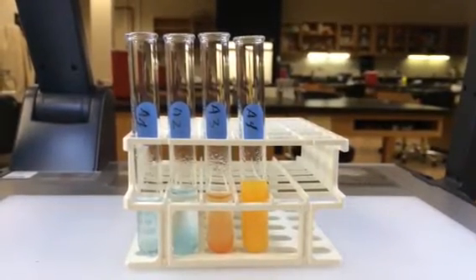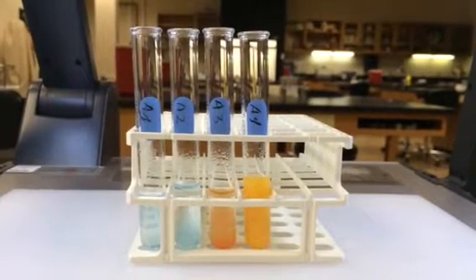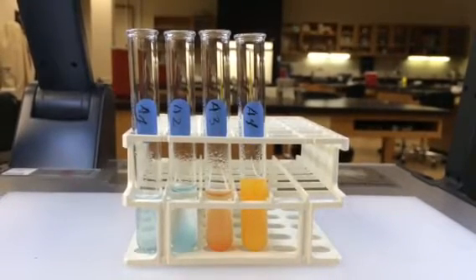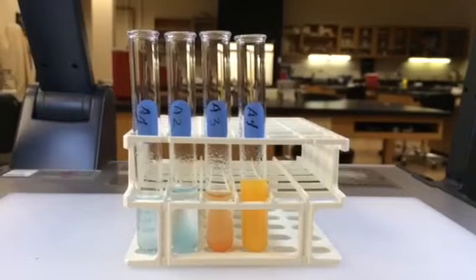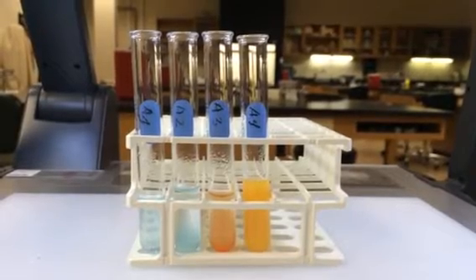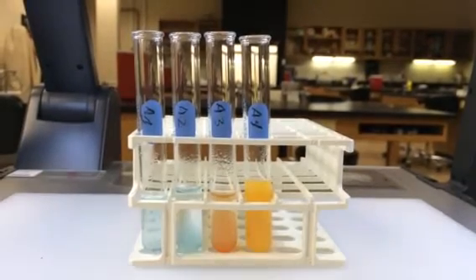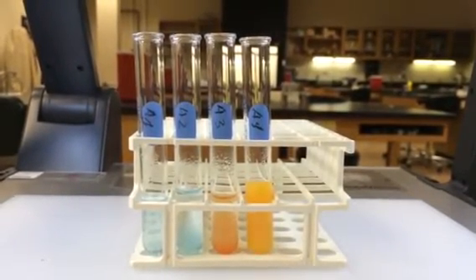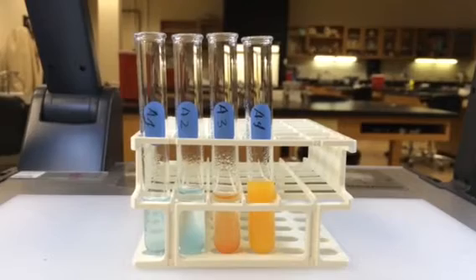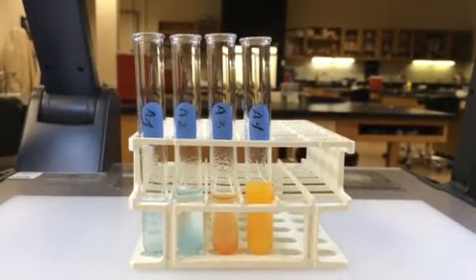Here are the results of test tubes A1 through A4, this time tested for the presence of maltose. Remember from lecture that maltose is one of the breakdown products of starch digestion. It's a disaccharide made of two glucose molecules. Starch is a long polysaccharide made entirely of glucose molecules, and as it's broken down, you end up with these disaccharide units of maltose.